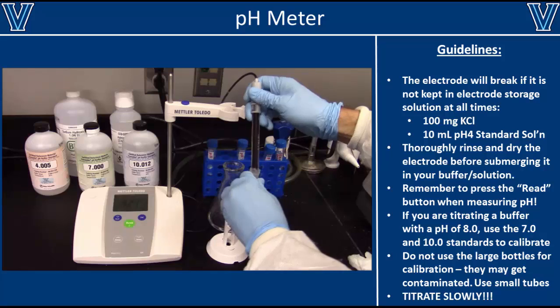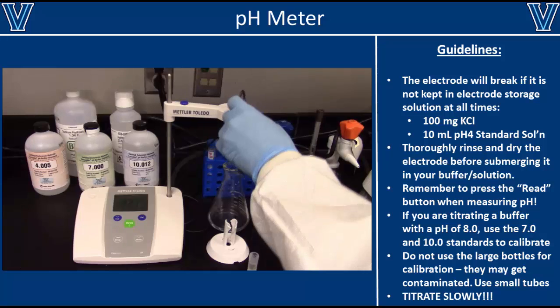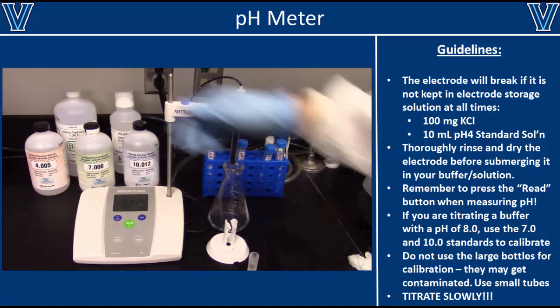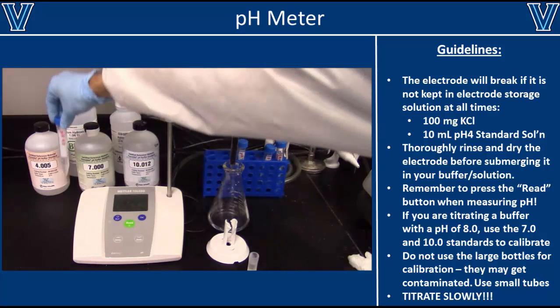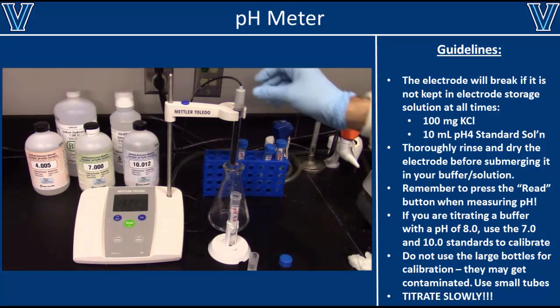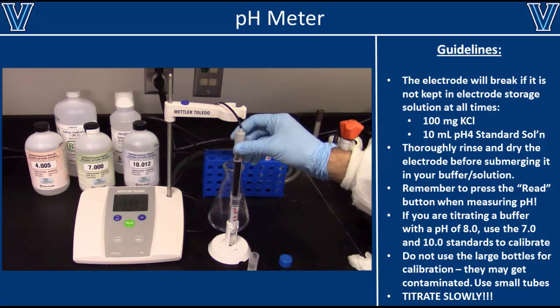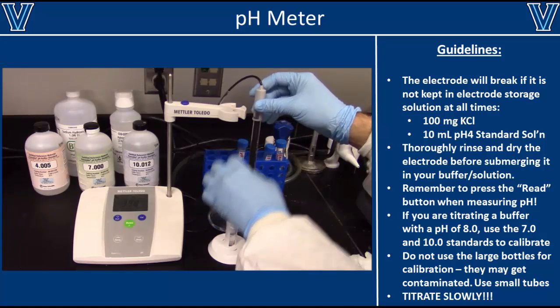When you are ready to use the electrode, remove it from the storage solution and thoroughly dry it with a chem wipe. Next, rinse off the electrode with MilliQ water and dry it again. To calibrate the meter, pour a little bit of the standard solution into a 15 ml tube. This prevents the main standard solution from becoming contaminated. You can refer to the manufacturer's instructions for specific protocols on how to calibrate your pH meter. In general, pH standard solutions of 4, 7, and 10 are usually used to calibrate pH meters.